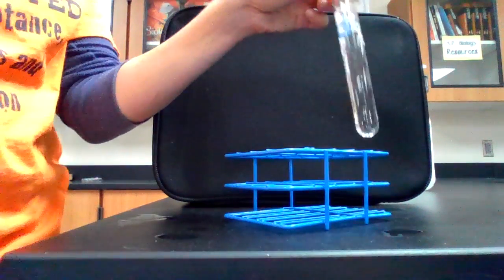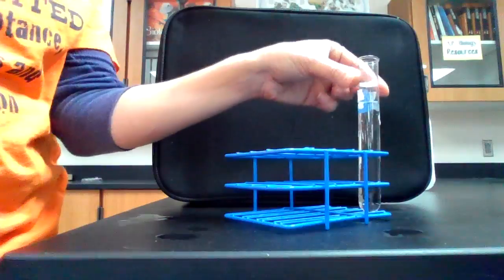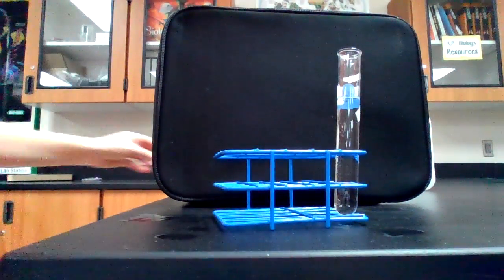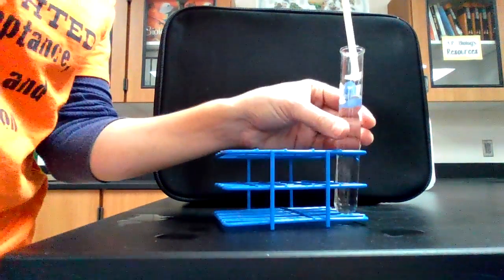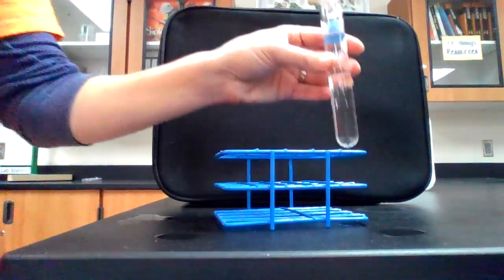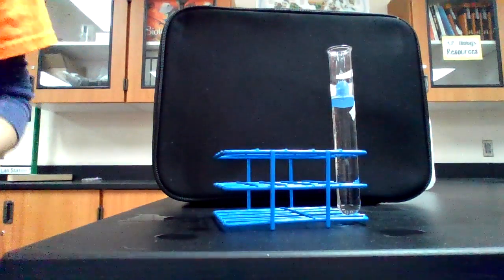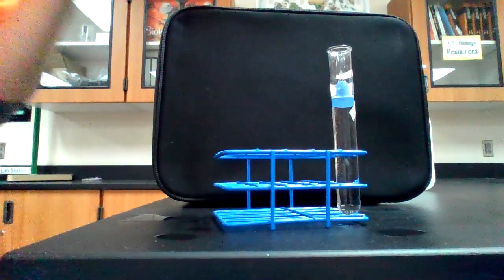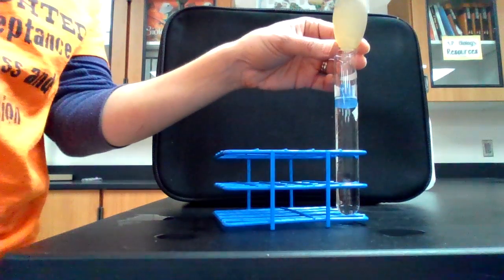All right. For the remainder of the trials, I'm just going to set that in there so that you can see what's happening a little more clearly. I'm going to remove that first one, and we might redo that first trial. I have an extra bead here, so we can do that a few times. So here is trial number 2 for room temperature. Ready, set, go.